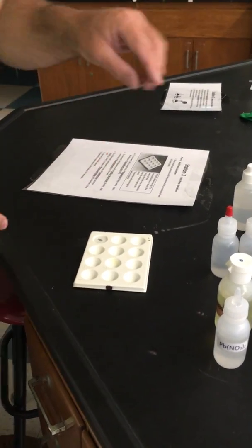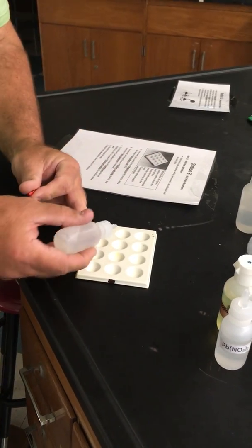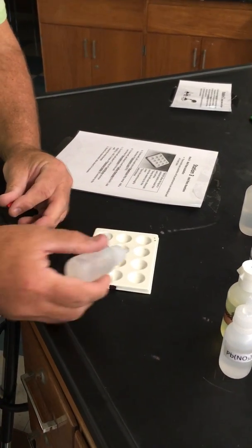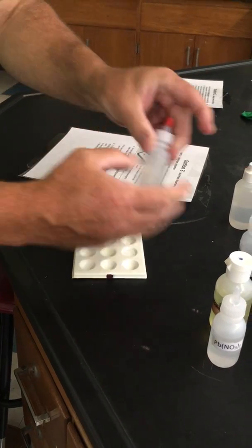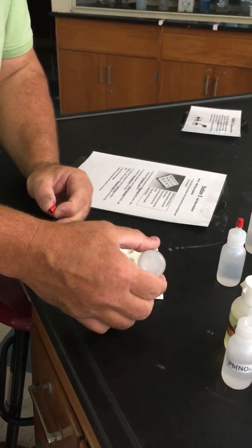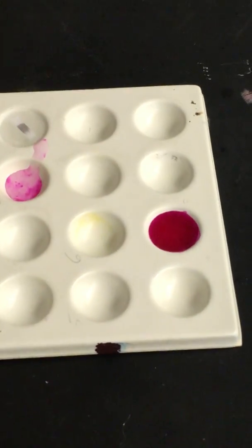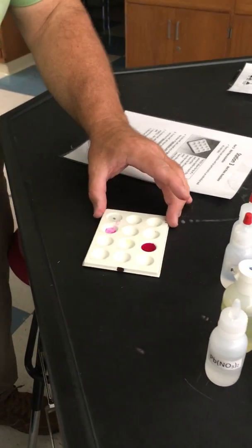The next one says about a half well of sodium hydroxide, which is a clear liquid. Did something right there already. Right here, the one to look at. And then I'm going to put a drop of this phenolphthalein. This is 2 clear liquids. 1 drop, and it turned it that really pretty magenta pink. A color change is a sign of a chemical change. Something new was made that's that color.